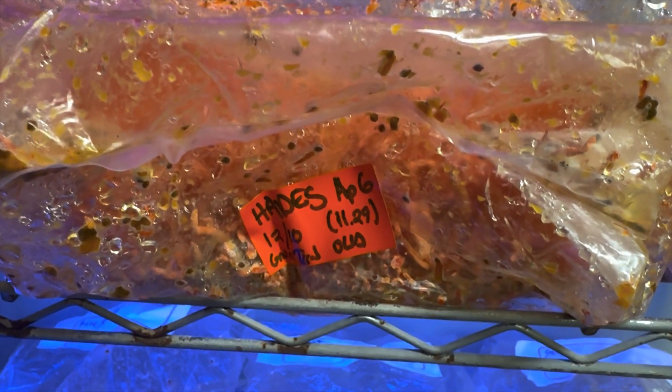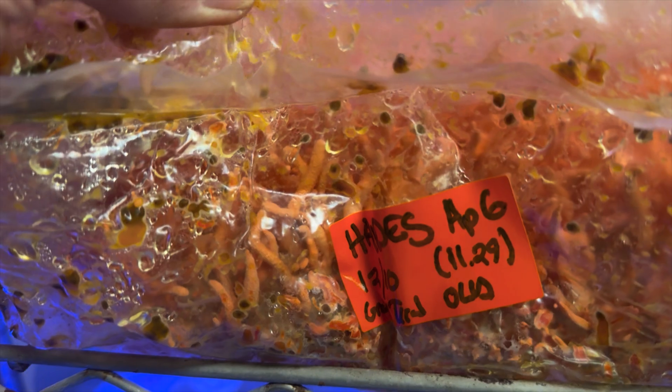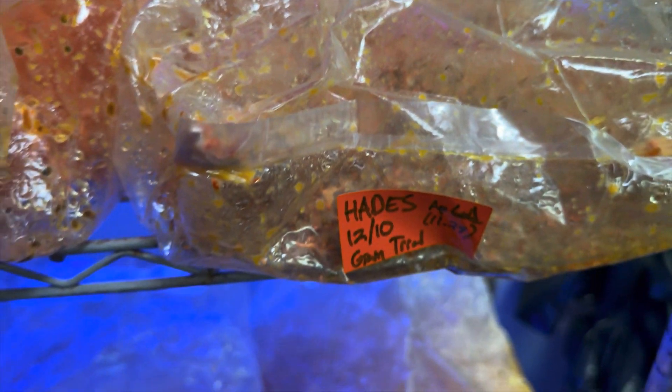That label is wrong — it's just straight Hades. This rice and millet bag seems to be doing really well. The combination of rice with small grains is performing quite well. Straight wheat, on the other hand — while it might be good for spawn, that hasn't been the case for fruiting. Those look like the worst.